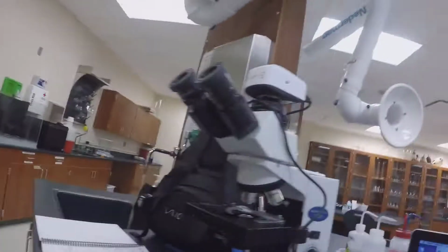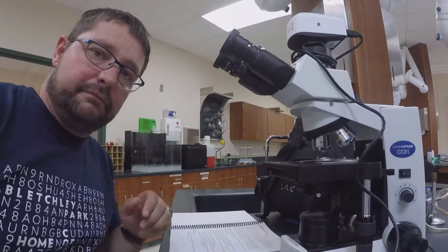Well, Dr. Clark here, and today we're going to demo lab number 6, Microscopy and the Cell. The first thing in this lab is parts of the microscope.